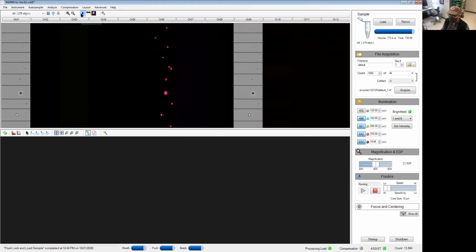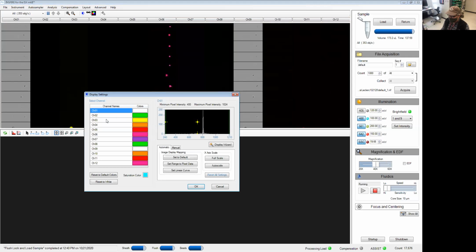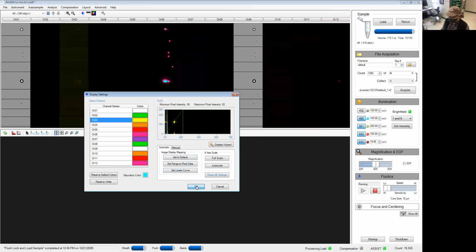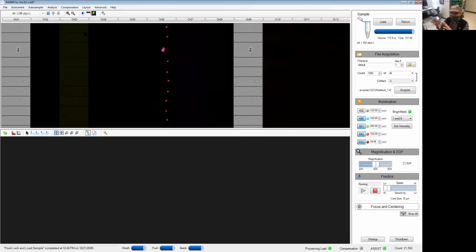Second one is this icon here, the display settings. If you're having issues figuring out how the beads look in a specific channel, you can actually change the intensity of the channel by moving this slider bar here to change the way the beads are being displayed. It doesn't change the actual intensity that's being measured. It just changes the way it's going to present it on this graph.